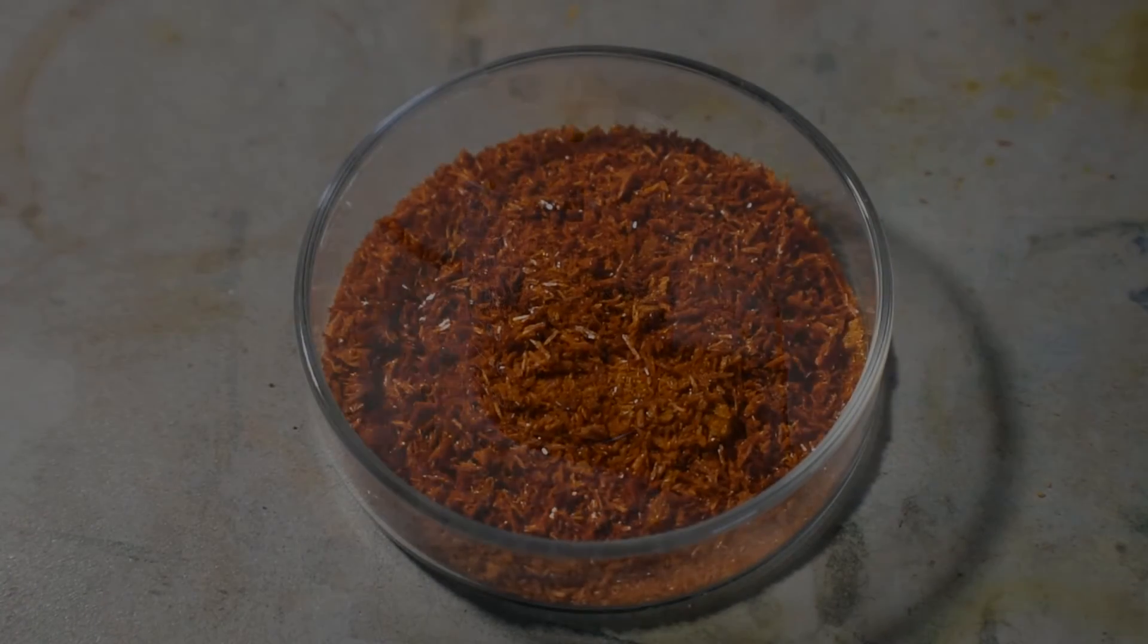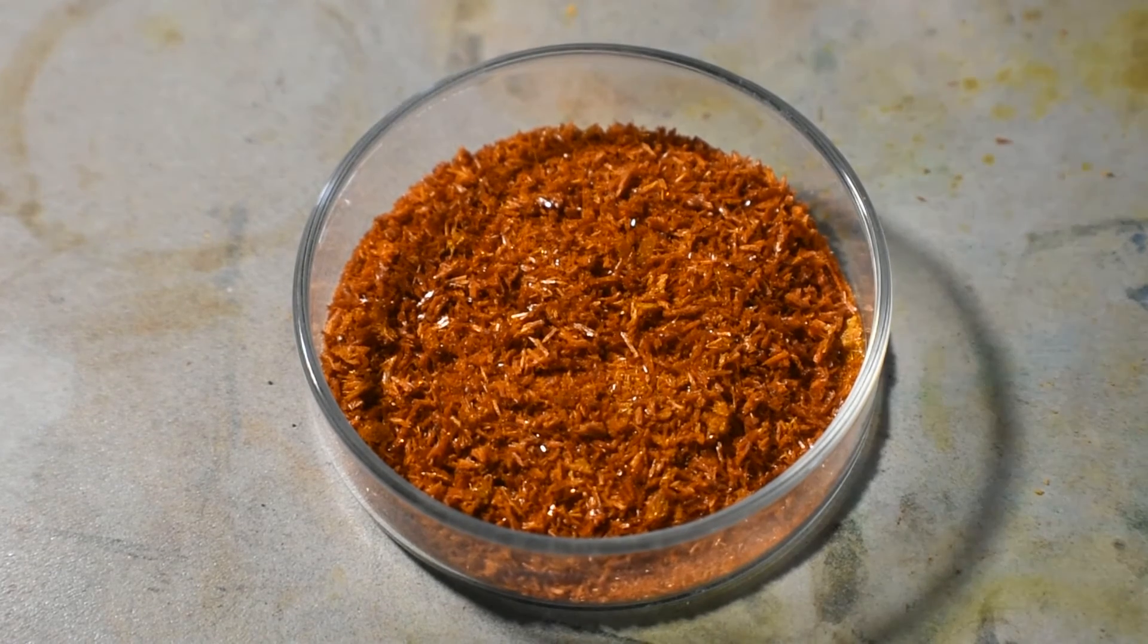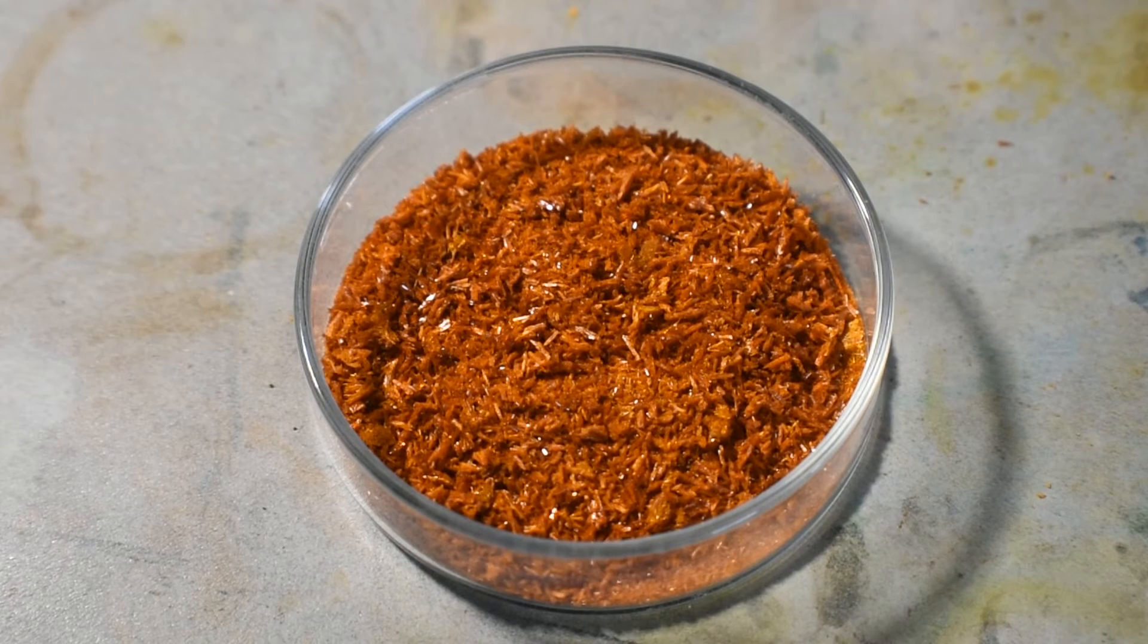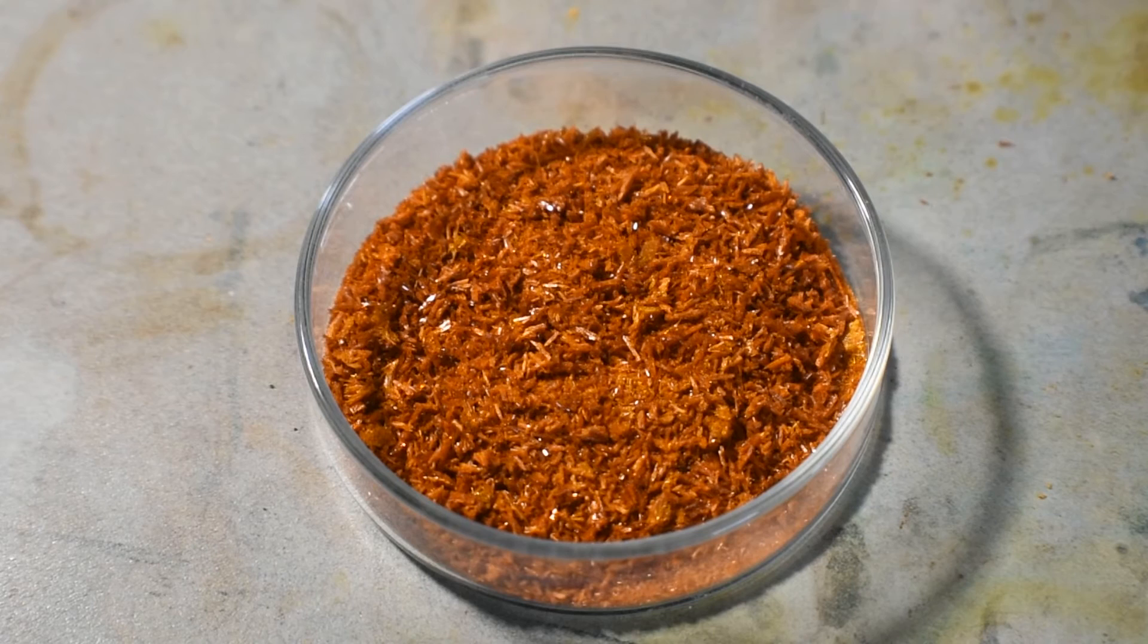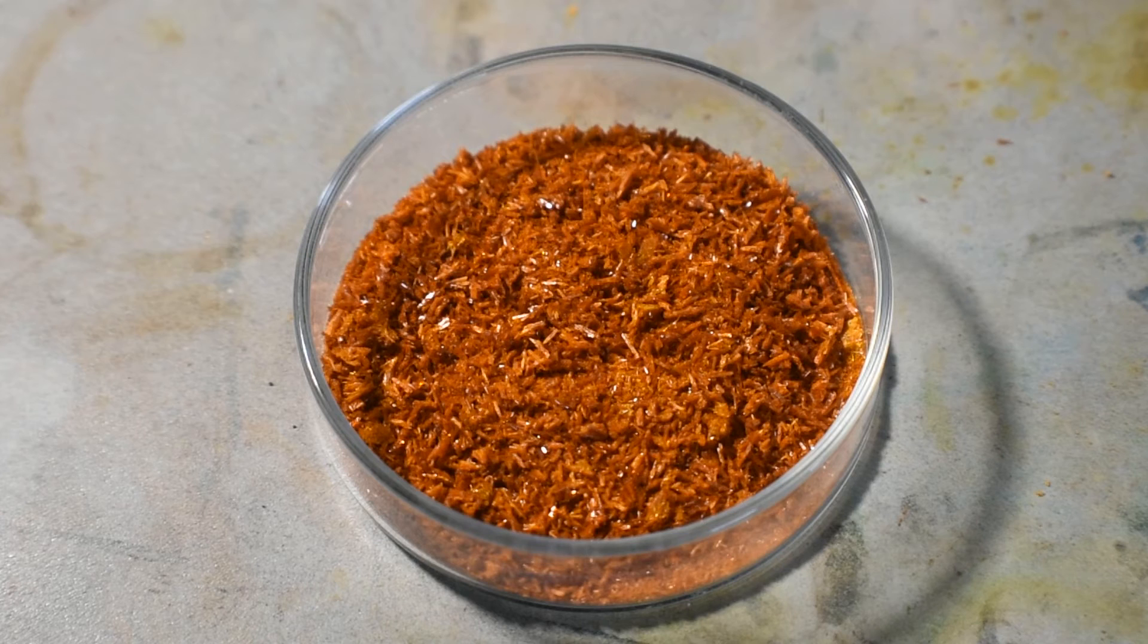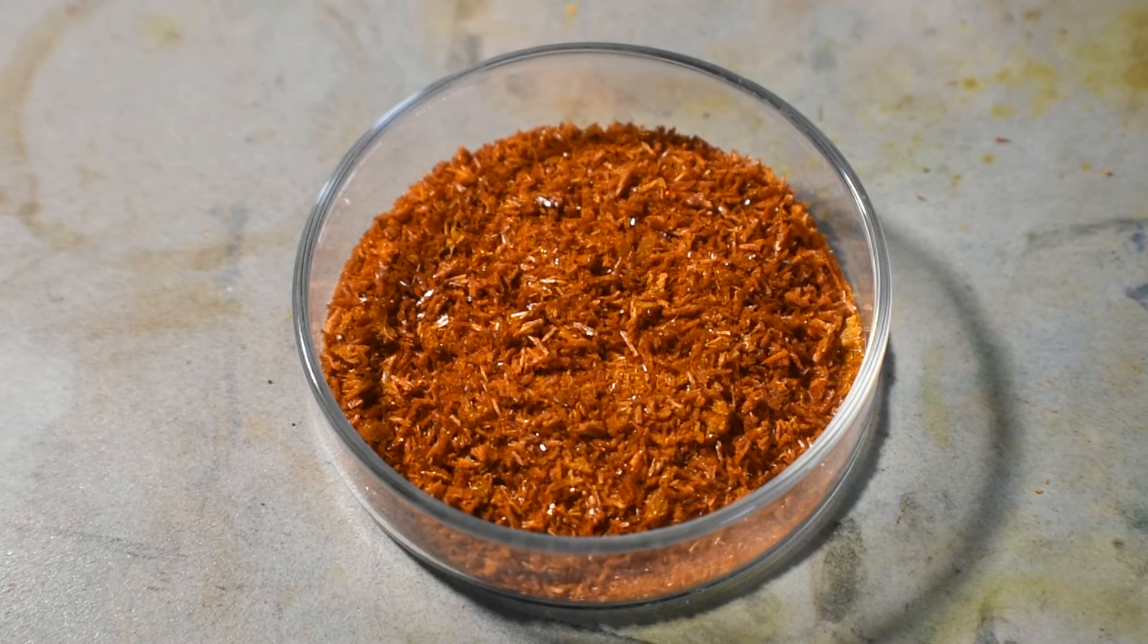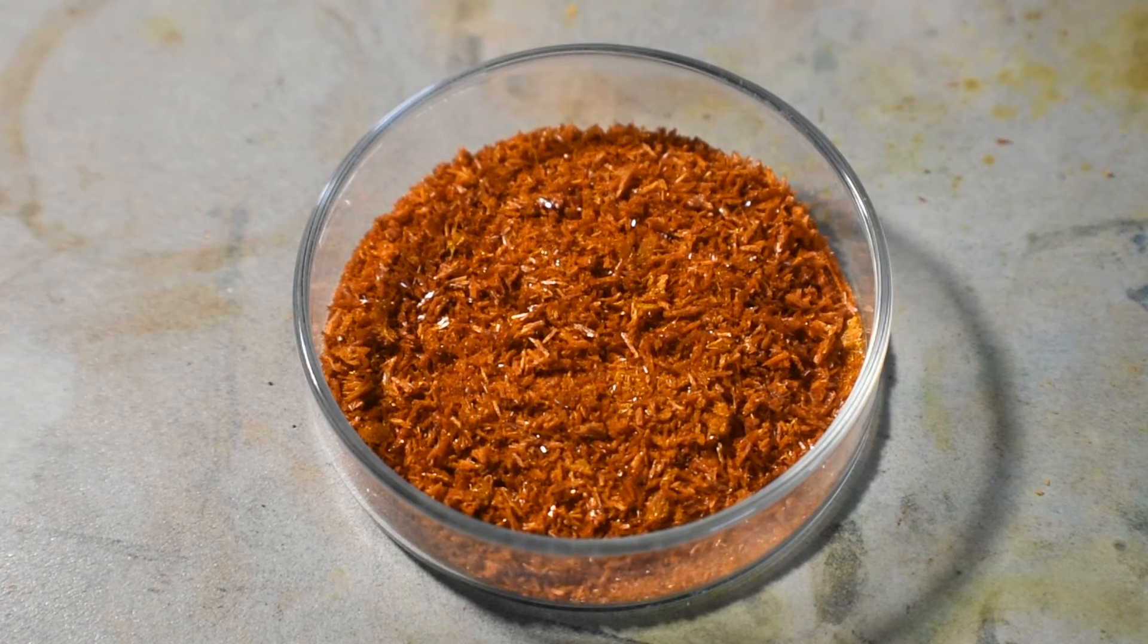So here's the product after recrystallizing from hot water. It's a very nice sort of dark orange solid, which, very surprisingly, looks exactly the same on camera as it does to my eyes in real life, which is kind of unusual. Most of the things I make look different, you know, in one way or another on camera, as opposed to how they look in real life. So this is interesting, I guess. Quite a successful synthesis. I haven't had this synthesis fail once. It's been successful pretty much every time and has been really interesting and pretty beautiful.